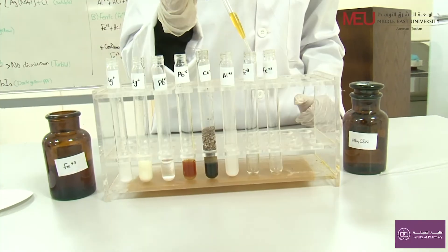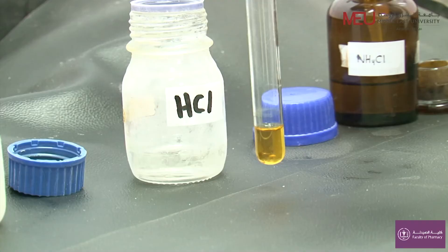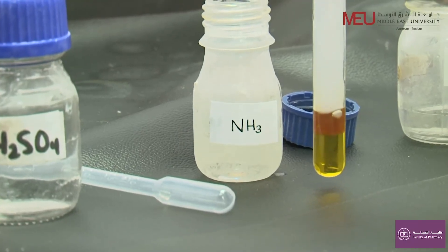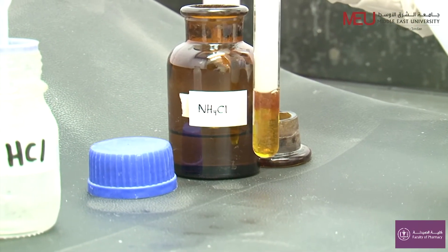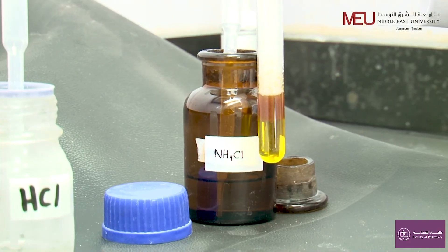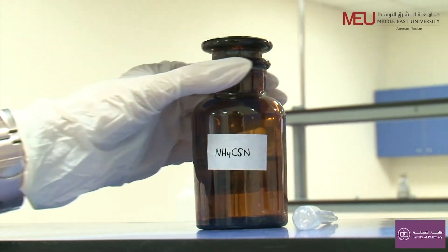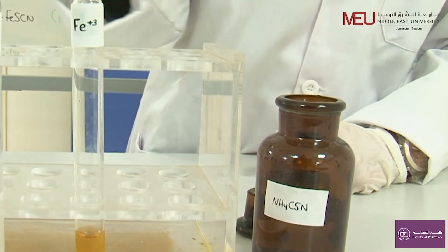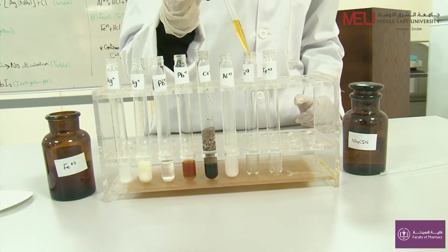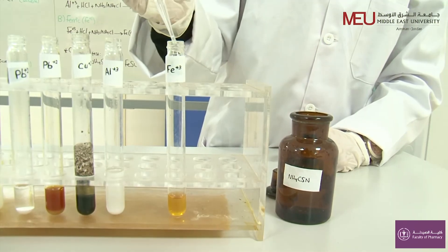To a solution that contains ferric ion, add 1 ml of HCl, 1 ml of NH3, and 1 ml of NH4Cl. A brown precipitate will be formed. To confirm the compound contains ferric ion, add 1 ml of ferric ion solution to 1 ml of ammonium thiocyanate and observe the result.